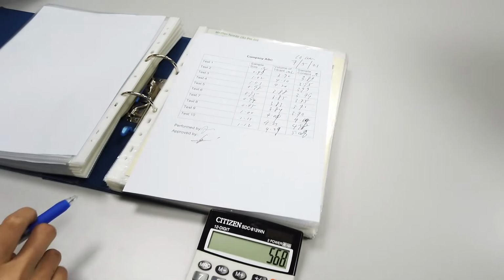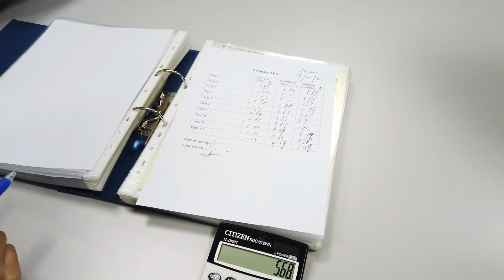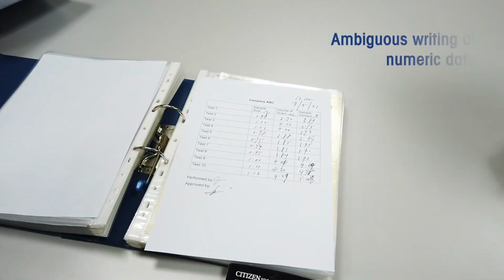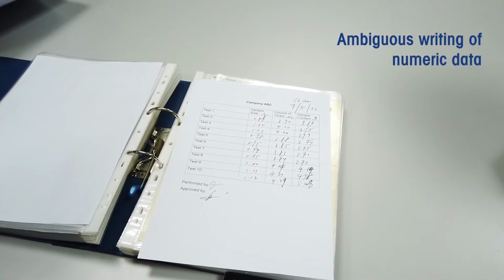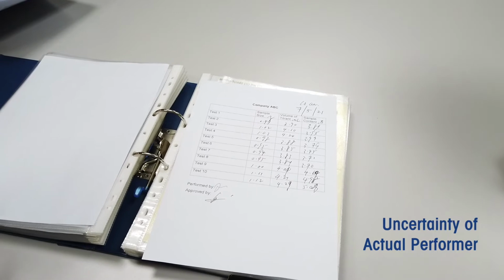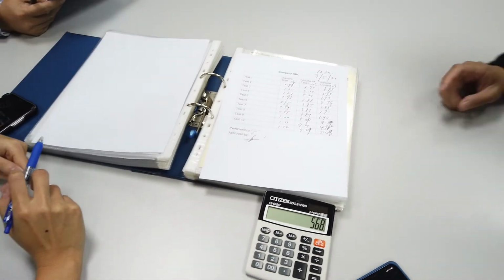Okay, let me check. These are the results for batch 8, but the handwriting here is not clearly written. So if I do the calculation again, we should be able to get the results within specifications. Okay, so it could be a pass. Yes. Are you able to see when this was done or who did this? As per what is written here, the test was performed on 7th of May at 10 AM. As for who performed it, this signature looks like either Peter or Vincent's signature.